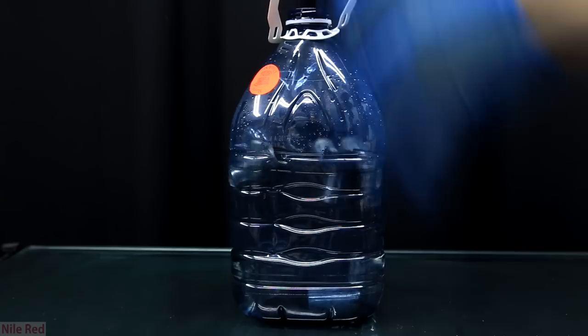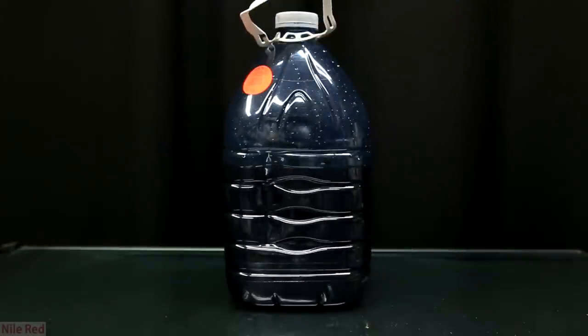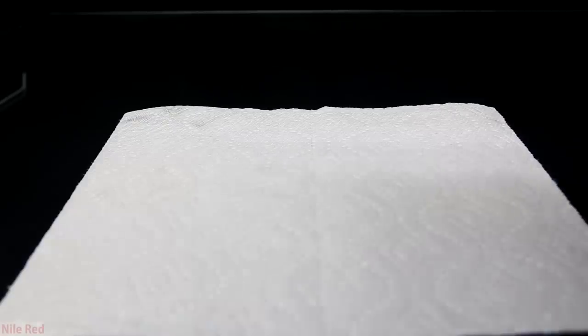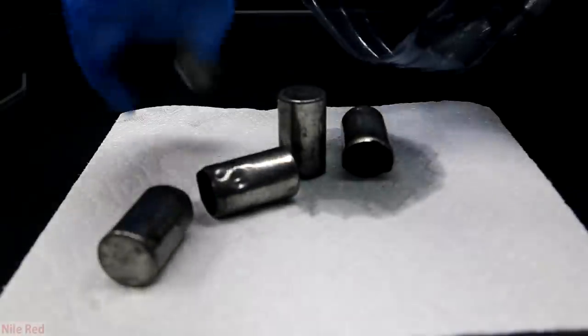I had to empty the water every time, refill it and do several rinsings but once it was done they were all fairly clean. Although they were no longer completely covered with manganese dioxide they all still had a little bit on it.